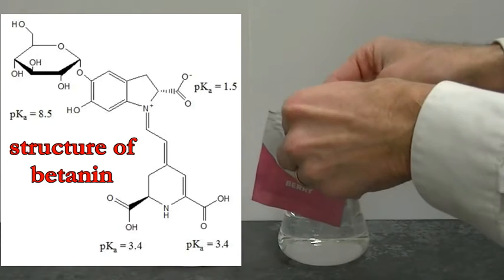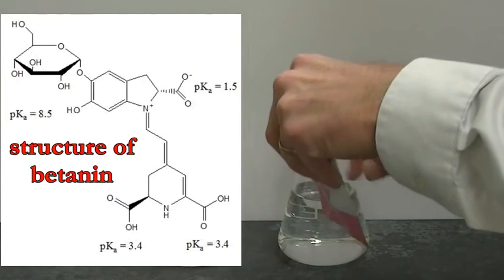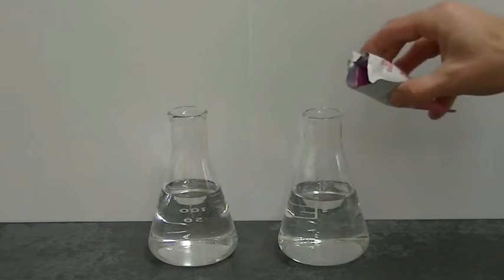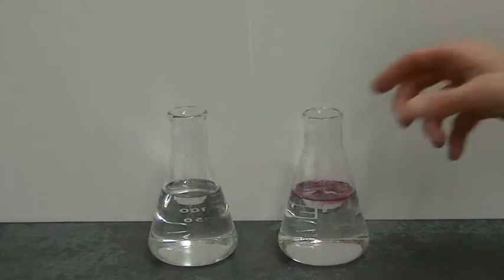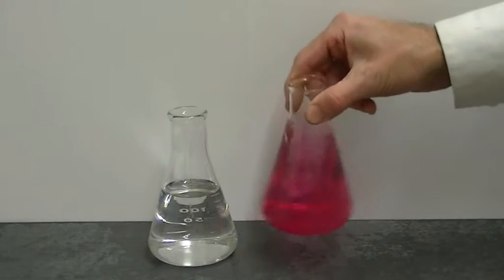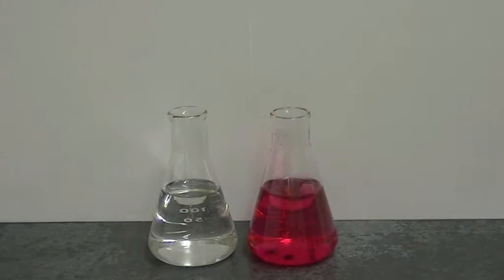Now betanin is a charged molecule, so therefore it should dissolve well in water through ion dipole forces. I have some water over here. I'm just going to add a little bit of the berry dye to that, give that a little swirl, and indeed we see that the dye dissolves well in the water, which is consistent with the dye containing the molecule betanin.